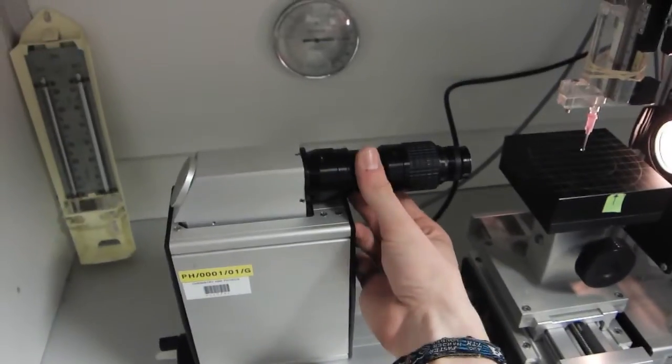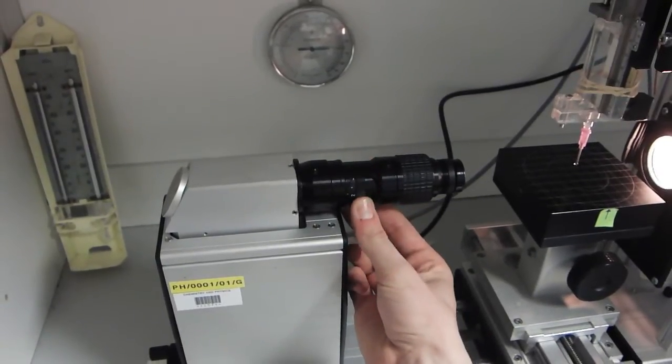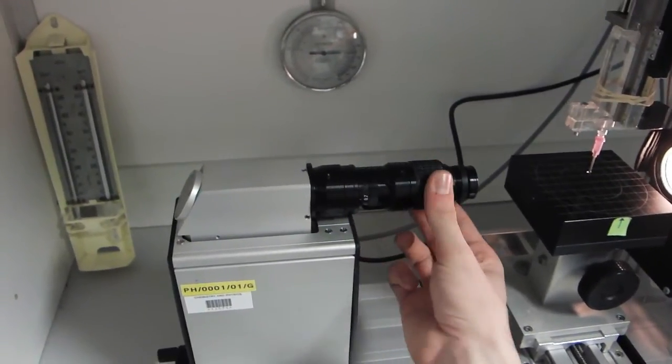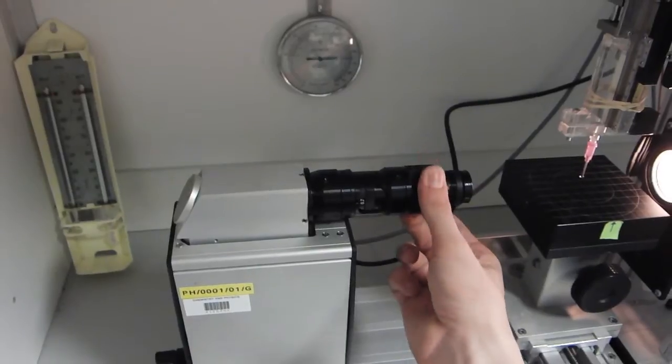These dials on the camera control the zoom level and focus. We make adjustments to these to get the best image possible. The effect can be seen here.